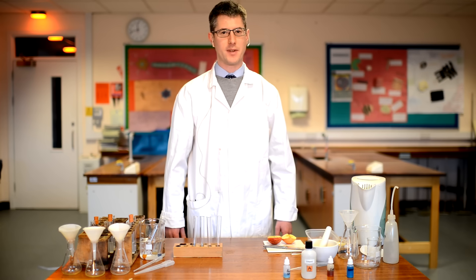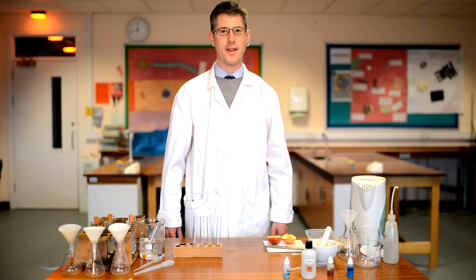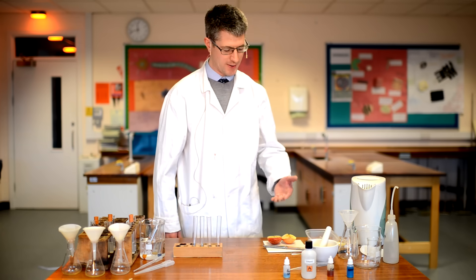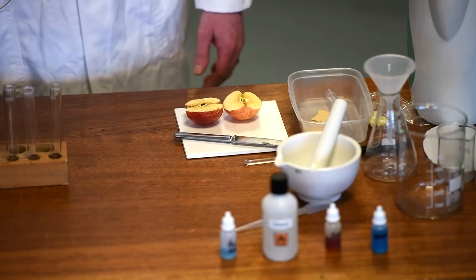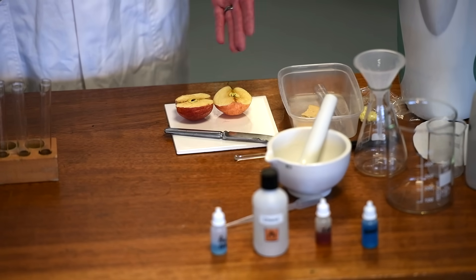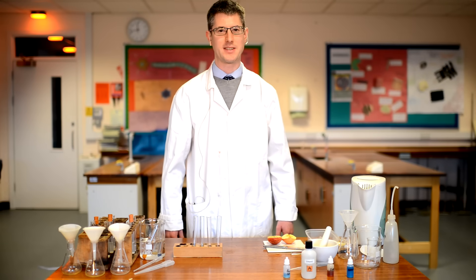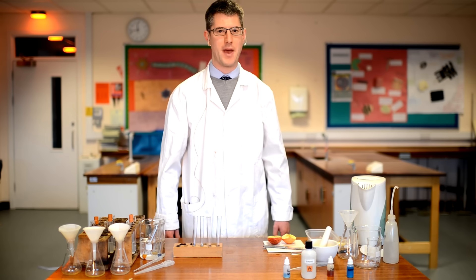The first thing we have to do is prepare some samples of food for testing, and then we're going to use the food tests to identify which different chemicals are found in these different food types. We're going to test some apple, some biscuit, and some cheese. The order I would recommend is biscuit, then apple, then cheese — essentially they are in order of messiness, and you have to clean up between each one. Leave the cheese for last because it causes the most mess.